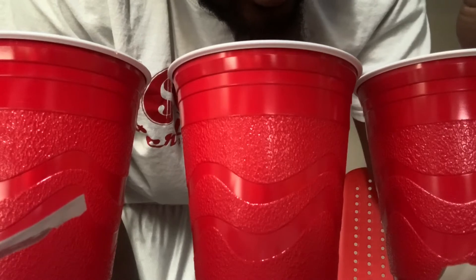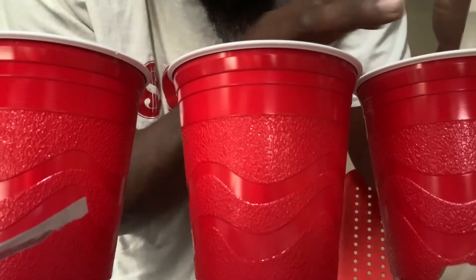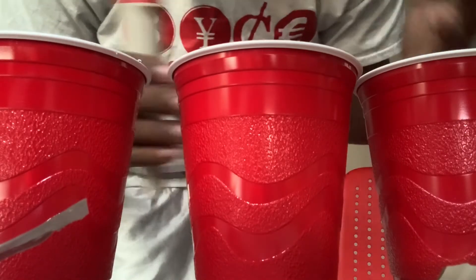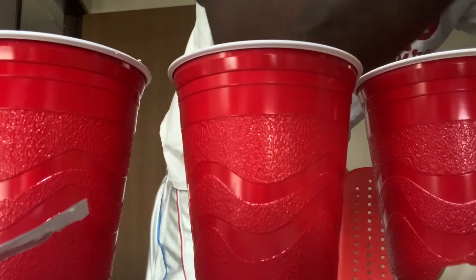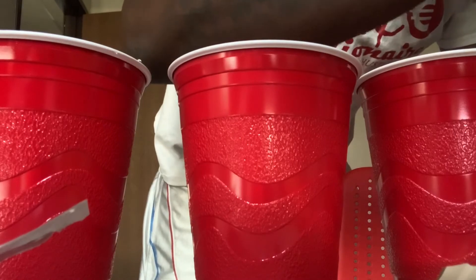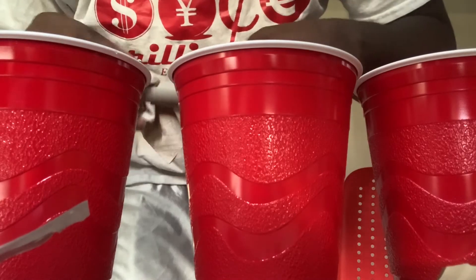Here we go, calibrate it guys — 6.86. I'm going to turn it off. Sorry again for the view, but you guys have to take my word for it. We're going to go rinse this off — actually we got some water here, so pour this in here, rinse off the probe. That's one thing they don't explain in the instructions: make sure between calibrations you rinse off the probe, that way it's not contaminated with the last calibration.